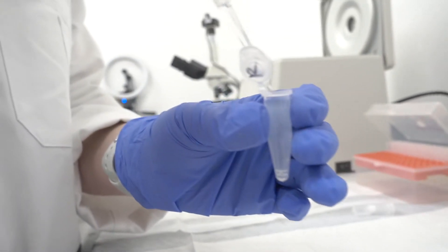Now I'll be doing a short experiment to show you why the Invent Biotechnology MINUTE Kit should be used as an alternative to RIPA buffer. Here we have the two samples.